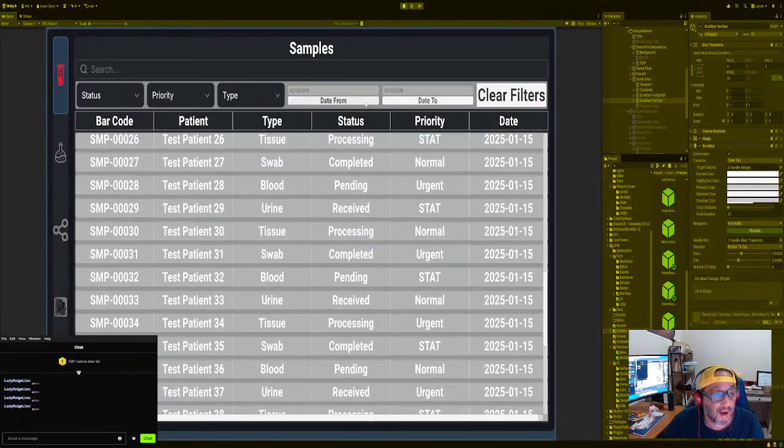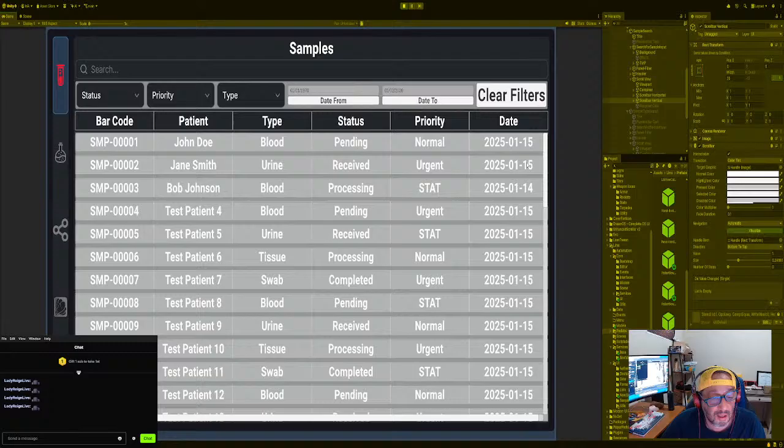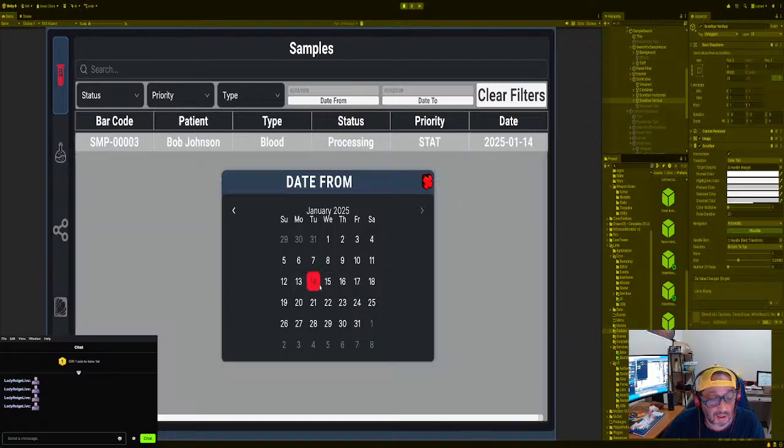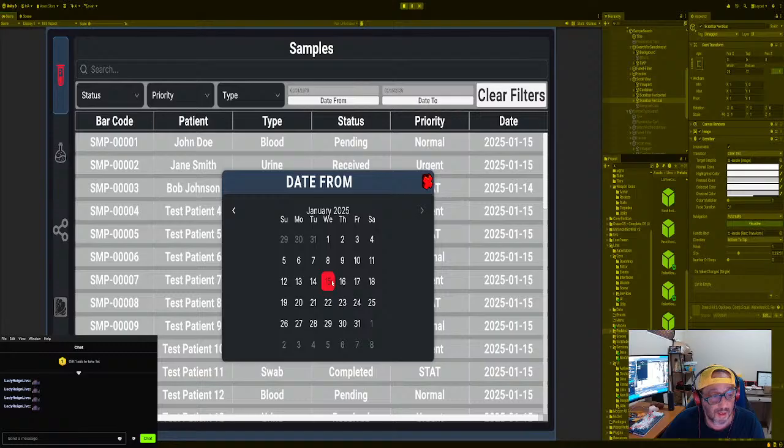Okay, so let's go back to the calendar. The date from is 1970. You see how things change. I want everything from there, but I don't want anything before 1/15/25. So we're going to go here. This is January 26th. We'll go to January, right? And I want everything up to the 14th. Do I get that? Yeah, there's only one up to the 14th. Okay, so we know that it's working now.